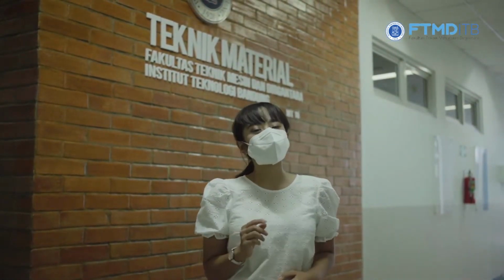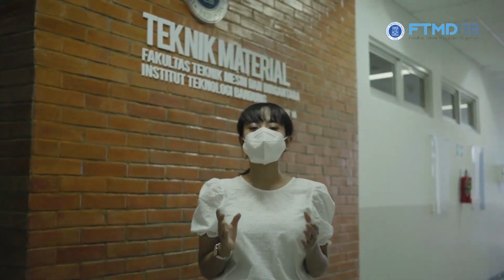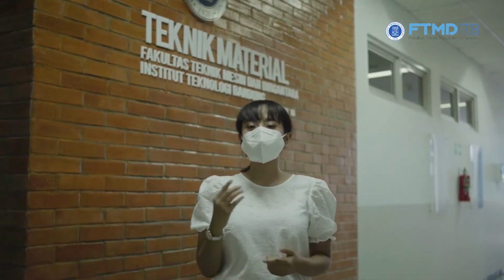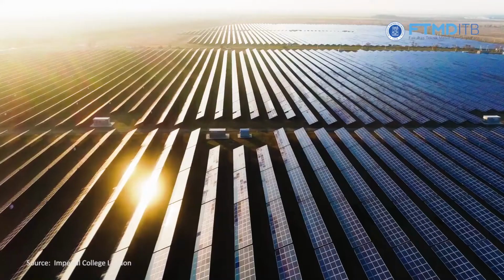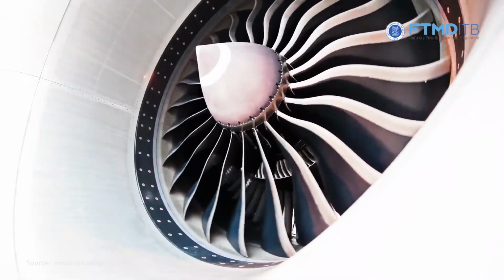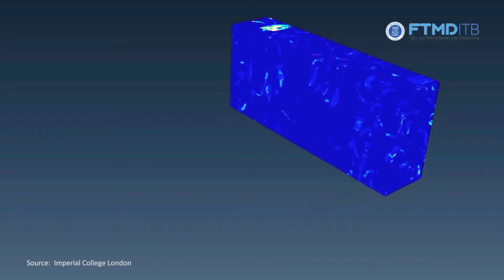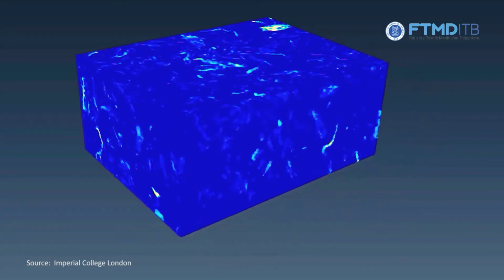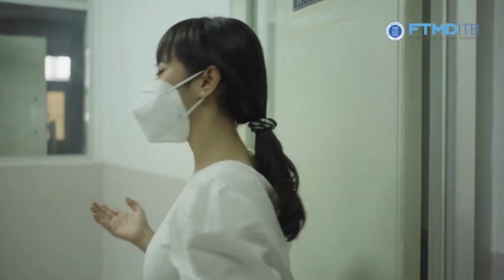Materials engineering is a science that studies the structure, processing, properties, and performance of a material. Areas studied include metallic materials, ceramics, polymers, and composites. These materials are later developed for broad applications such as materials for energy, medical, and nanomaterials. I will give you a quick tour of our laboratory.